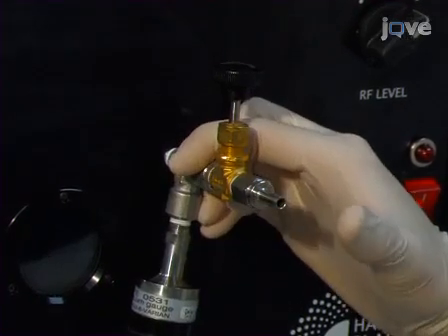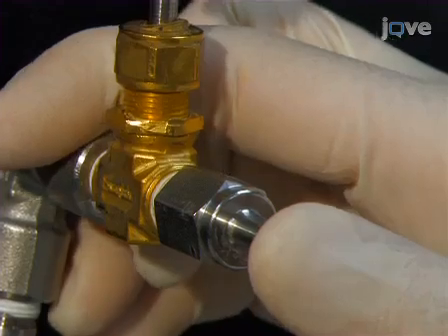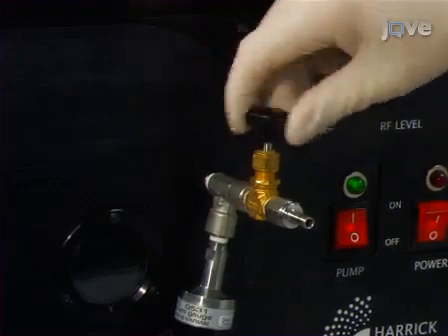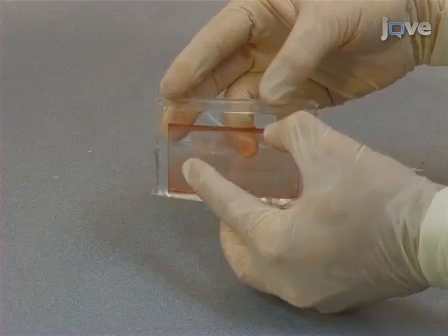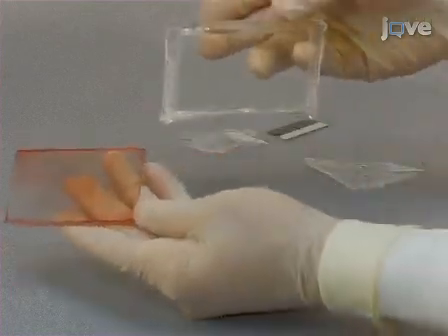Break any bubbles present in the PDMS by quickly removing and replacing a finger over the intake valve tubing several times to briefly allow air to flow into the chamber. The valve is closed for 5 minutes of uninterrupted degassing. Then, allow the PDMS to cure in the clean flow hood at room temperature for 1 to 2 days. Once cured, the PDMS is peeled off of the master pattern, forming a mold.